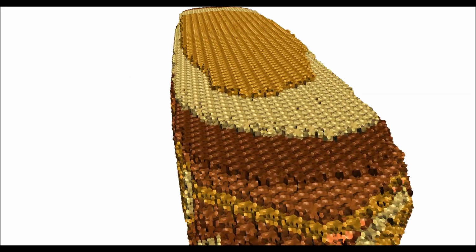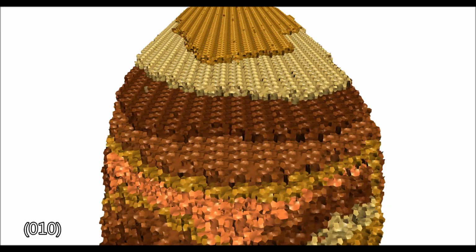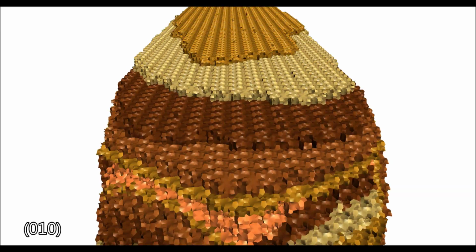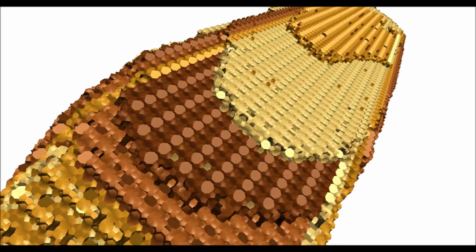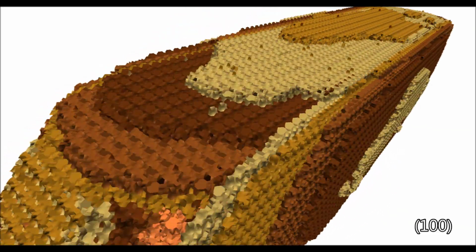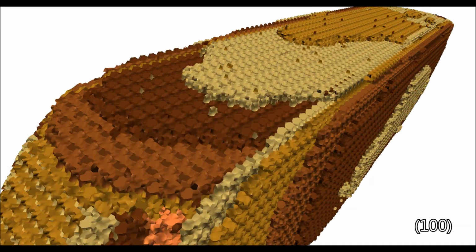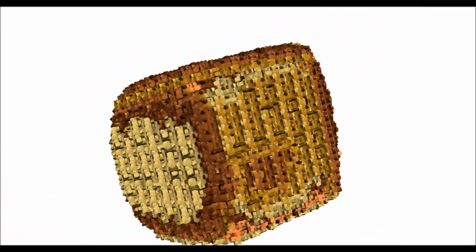In this video, I'm going to cover how to produce movies using the CrystalGrower visualiser, like the one you can currently see on your screen. The movies generated with the visualiser generally consist of smaller movies stitched together into a larger piece. I'm going to show you how to record these individual pieces, along with showing some pre-programmed movies, and then I'll give some examples of how you can stitch these movies together.